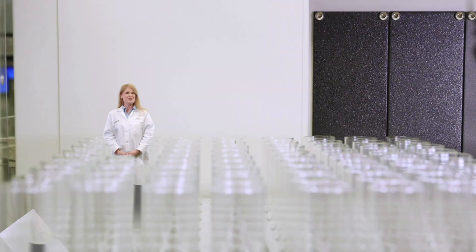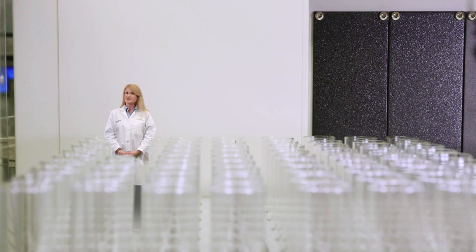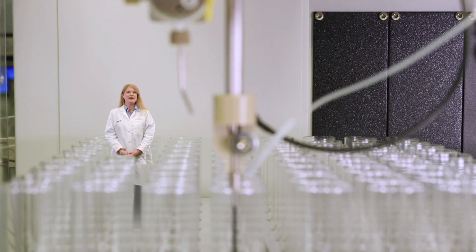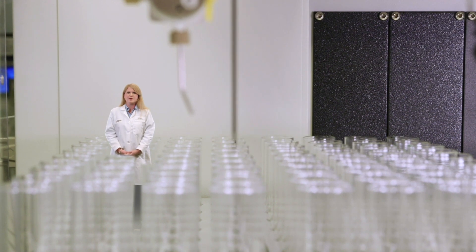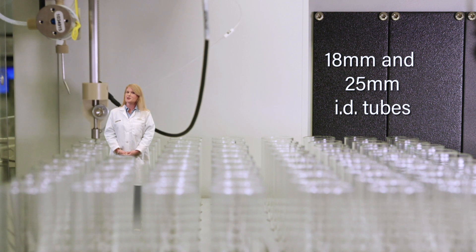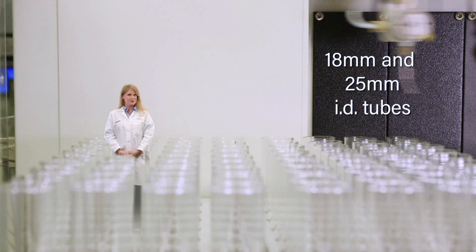Following the GLS, the purified sample is delivered back into the Open Bed Sample Manager high-capacity fraction collection system for assortment into commonly used 18 and 25 millimeter ID tubes.